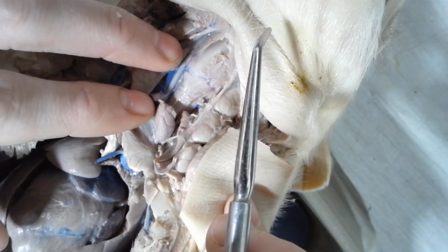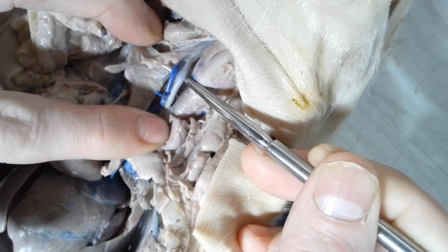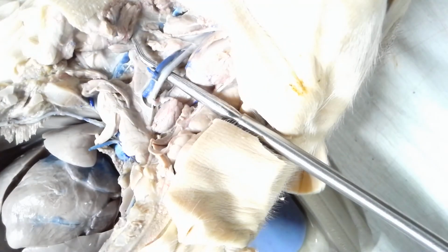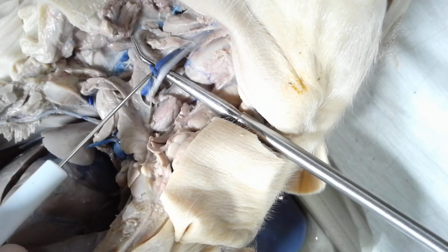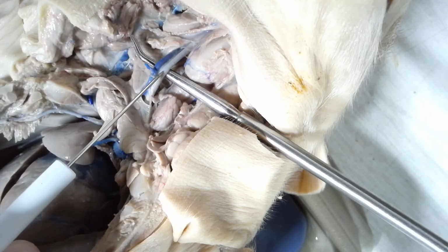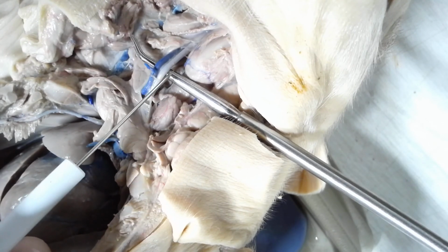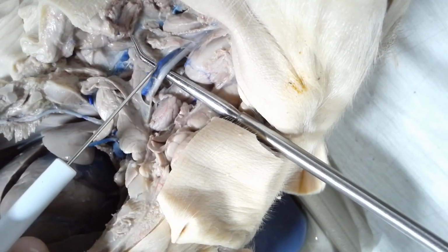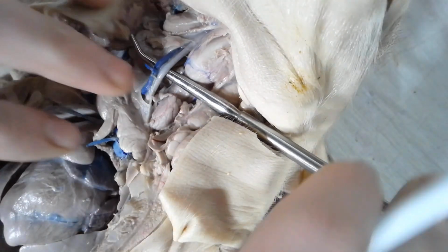Okay, on either side of the larynx and the trachea are 2 major blood vessels. So I'm going to pull this up right here. The blue one is the jugular vein. If I hold that up like that with a little pointer right here, blue is jugular vein. This one is supposed to have a red dye in there, but it did not get up to here on this pig. But this clear one right here, the most inner blood vessel, this is the carotid artery. They run in pairs. So the blue is the jugular. This clear one, which sometimes is pink, would be the carotid. And it's on the other side as well.